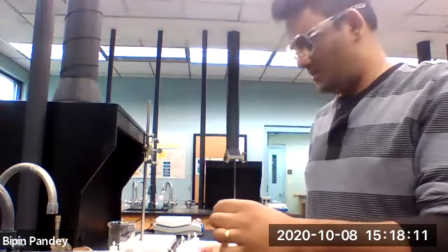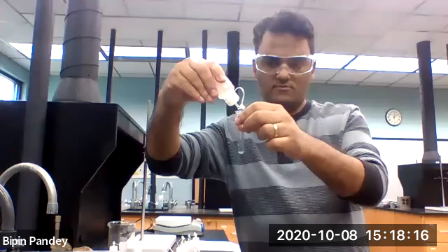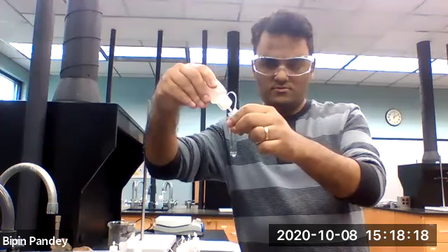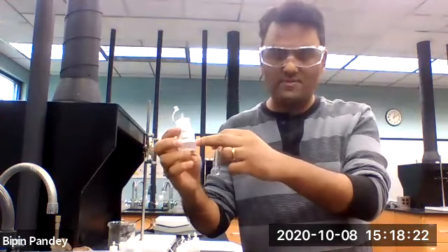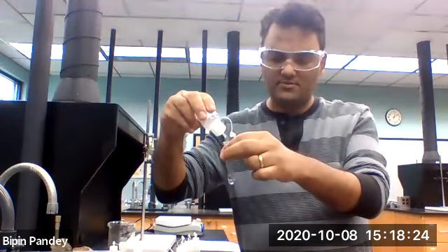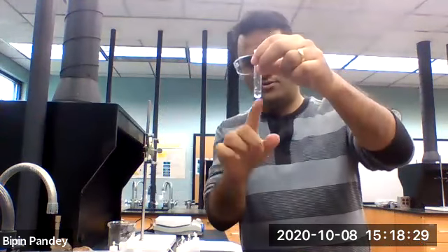Five drops of sodium chloride. Add sodium iodide to it, 5 drops. Nothing happened, no reaction.